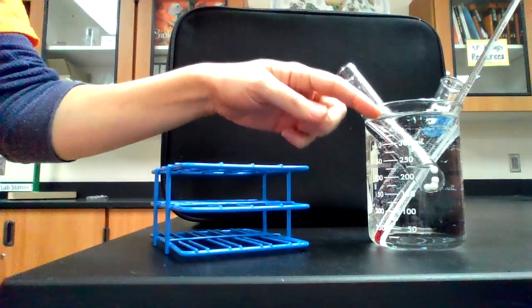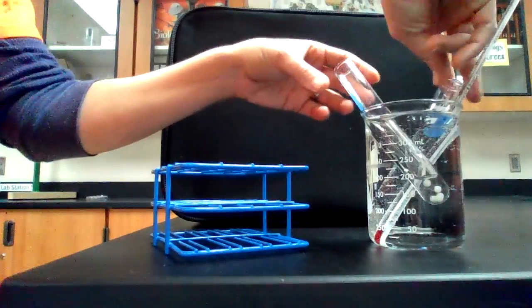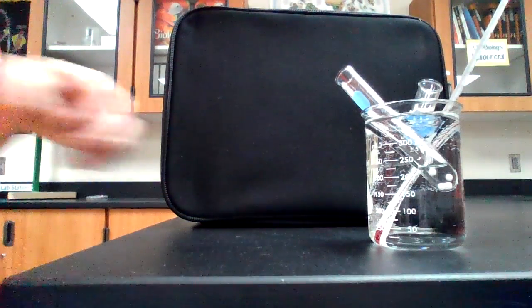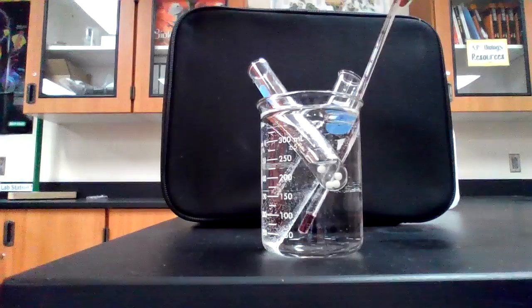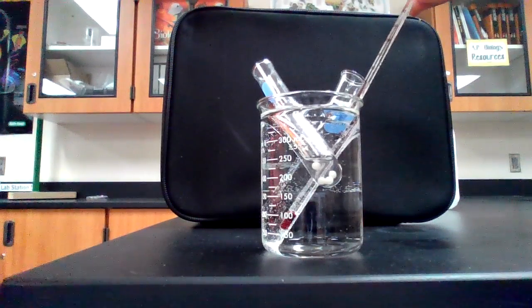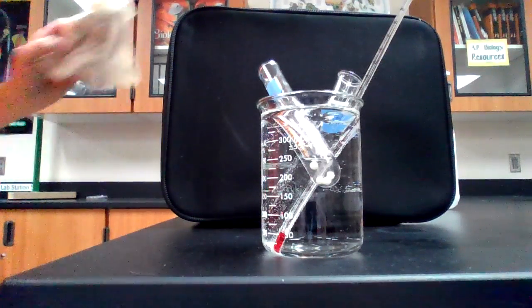It's just a beaker full of water, and in here I have a test tube that contains the yeast spheres that we'll be using and a test tube that contains the hydrogen peroxide that we'll be using. And they were all sitting in there so that they all came to the same temperature, and these were just sitting out in the room so they would come to room temperature. According to this thermometer, the temperature of the water in this beaker is 21 degrees Celsius. So that is approximately what room temperature is in here.